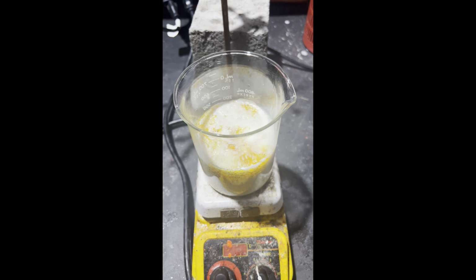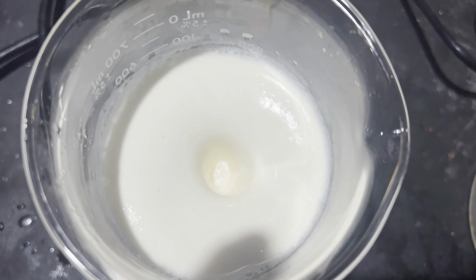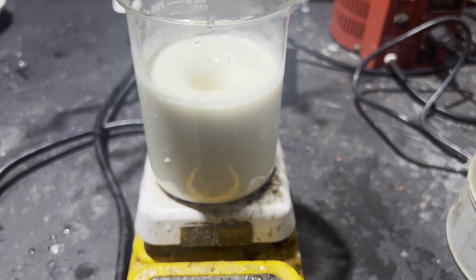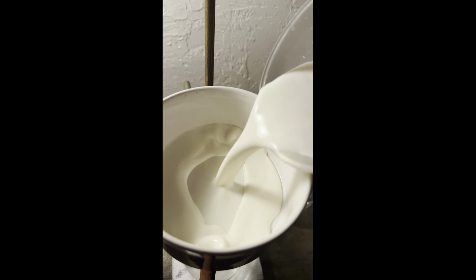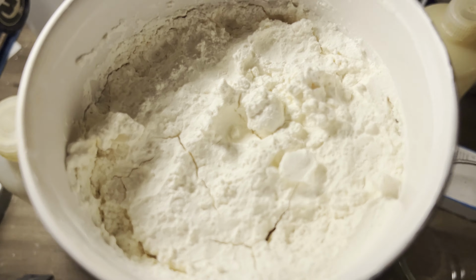It's important to add the sodium salt solution to the acid, and not the acid to the sodium salt solution, because apparently if you do, a less soluble acid salt separates that can't be completely removed from the m-nitrobenzoic acid. The acid is filtered off and washed with water.